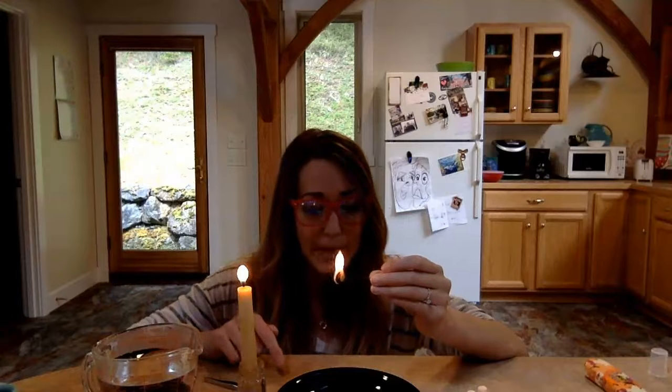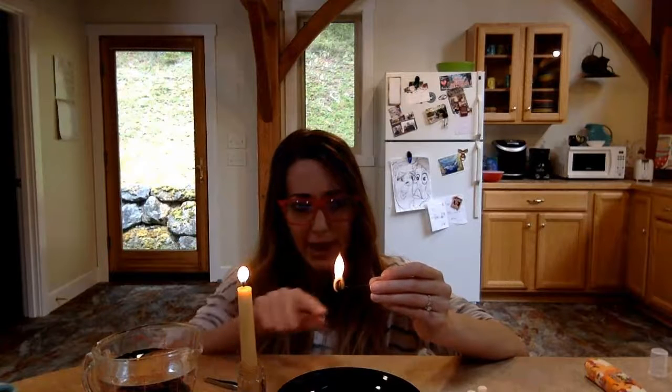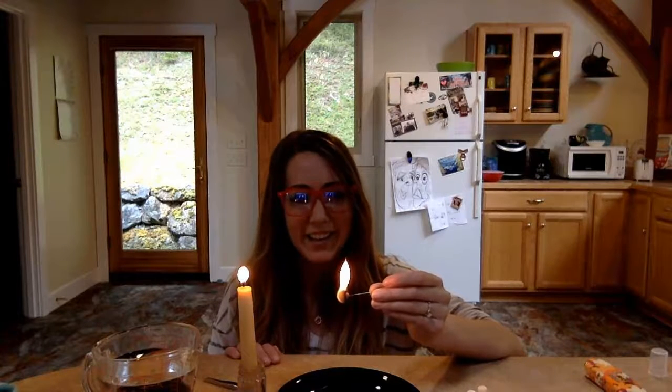Okay, so if you look closely on this one, a combustion reaction lets off water, right? And you can almost see just this slight condensation. My peanut that dropped onto my plate left behind this greasy, watery residue. And I've got my oils that are almost gonna drop if they don't burn first. It's really kind of cool to see. I think I got a higher flame on the cashew. What do you think?